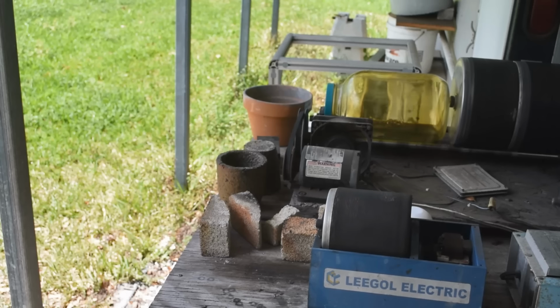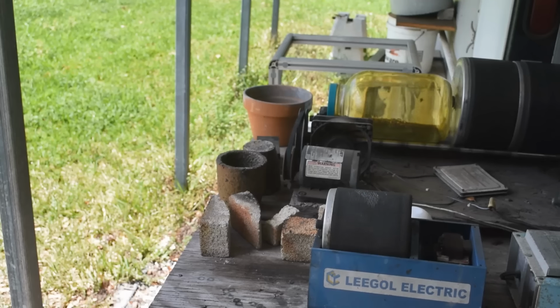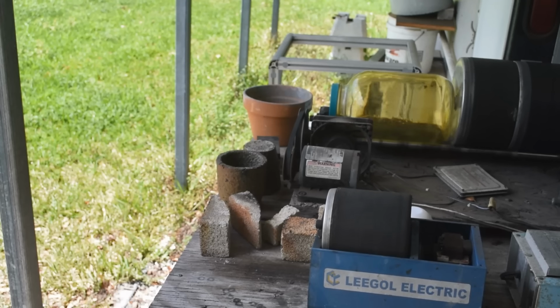I'll leave this on here for 15 minutes until about 2:23. And I'll take it off. We'll drain the liquid off, and we'll give it another treatment. And after 2 treatments, we'll take a look at the pins and appraise them and see whether they need a third. There is some agitation going on. So it's probably better than stirring it periodically and letting it sit, because we are getting constant agitation. So, okay, well, we'll be back in less than 15 minutes now, and see what we got.